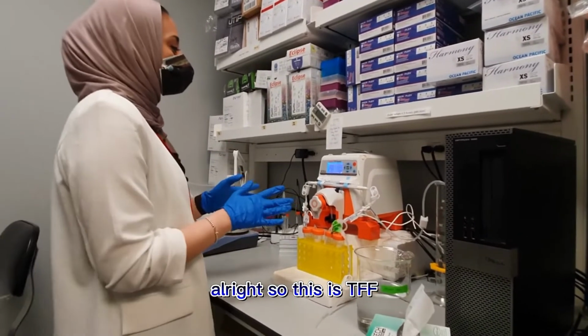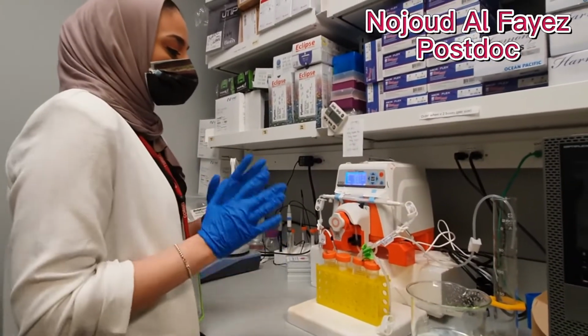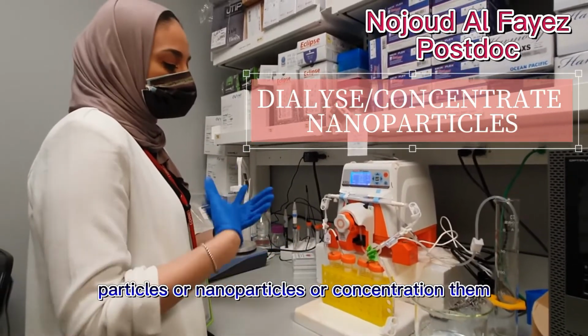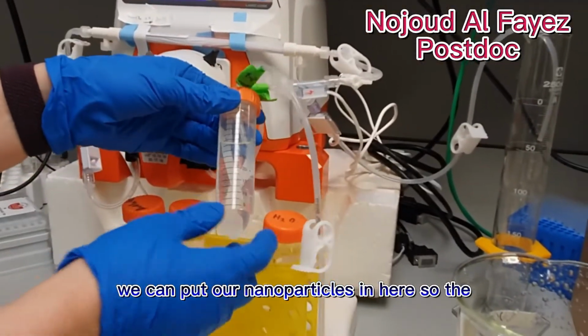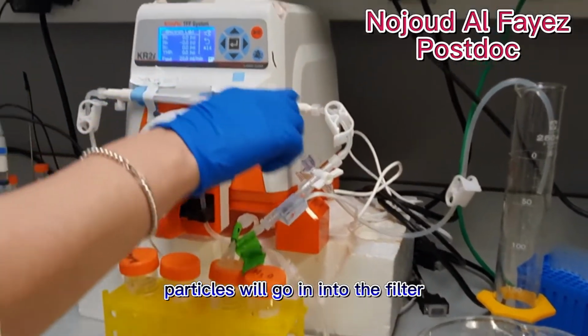Alright, so this is the TFF system, which is tangential flow filtration. We use it to either dialyze the nanoparticles or concentrate them. So what we have here is a filter, and we can put our nanoparticles in here. The particles will go into the filter.